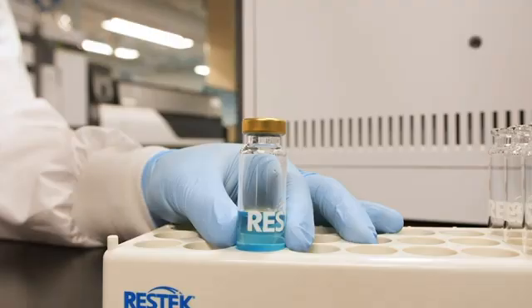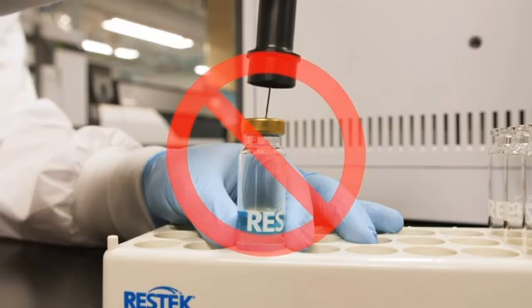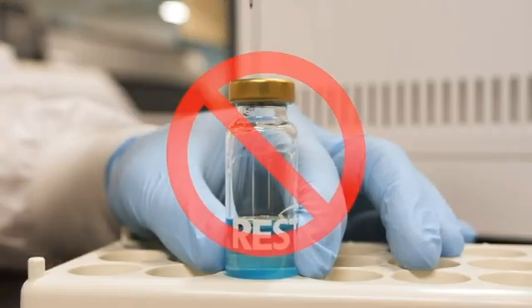Please remember that it is important to never reverse these steps. Never press down on the tab while inserting the tool into a vial or inlet. This will expose the fiber coating to the septum and damage the arrow. Likewise, never press down on the tab while removing the arrow from the vial or inlet. This will also expose the fiber coating to the septum and damage the arrow.